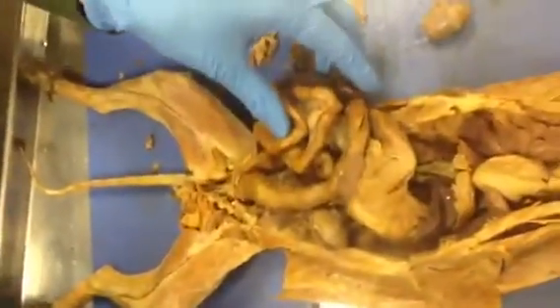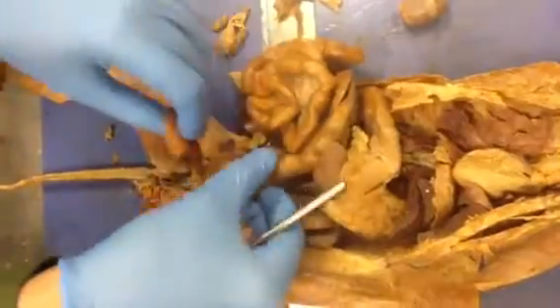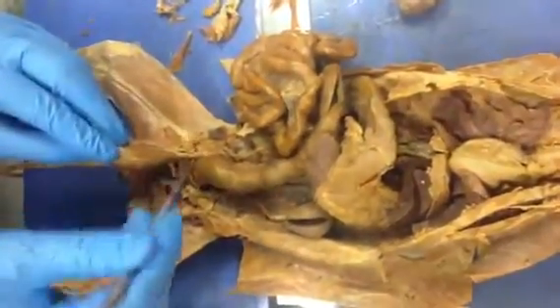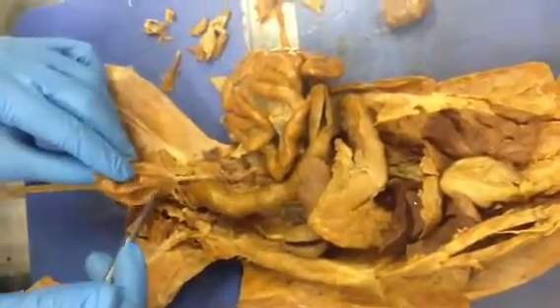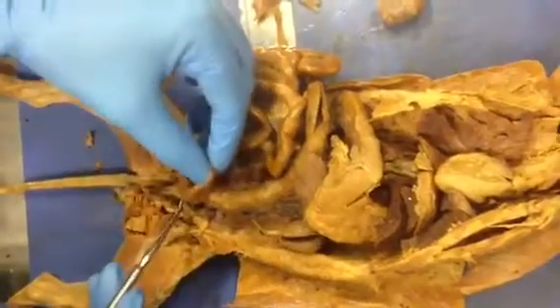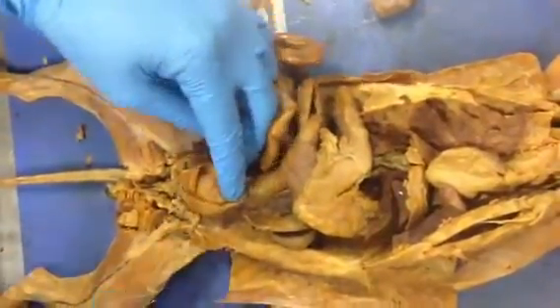Now, the left and right ureters, they come down, and one is severed, but here we have the right ureter, which comes down into the bladder here. So look where the ureters are coming. They're not coming up top here, okay? They're coming near the trigone. So the left and right ureters and the urethra, this region is the trigone. This is the neck of the bladder.